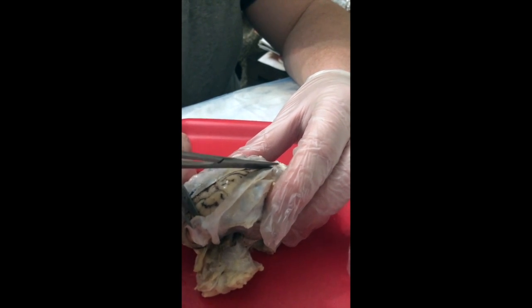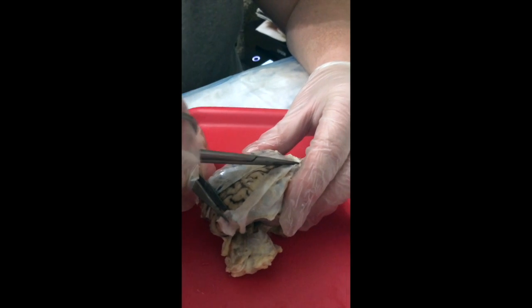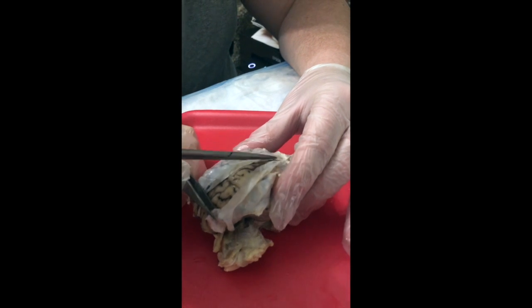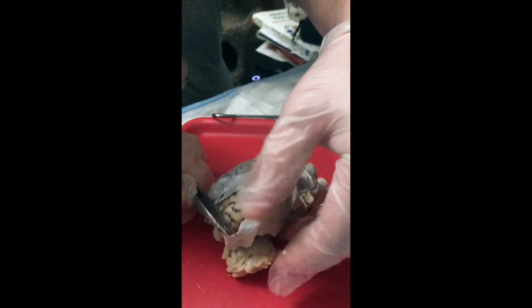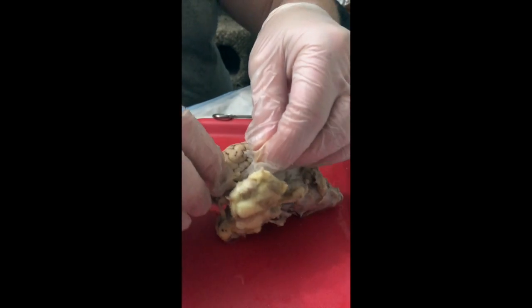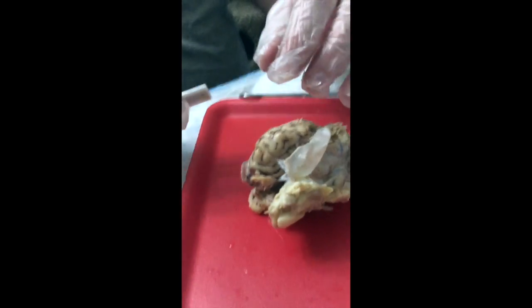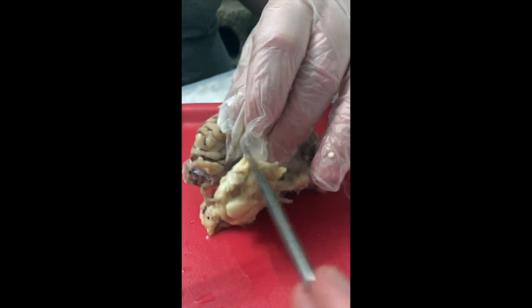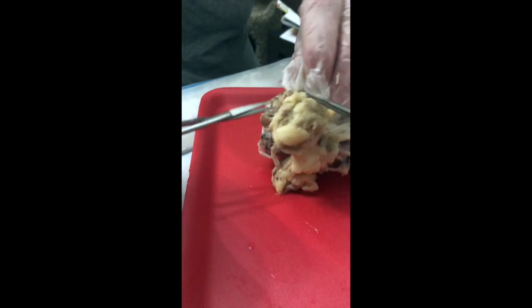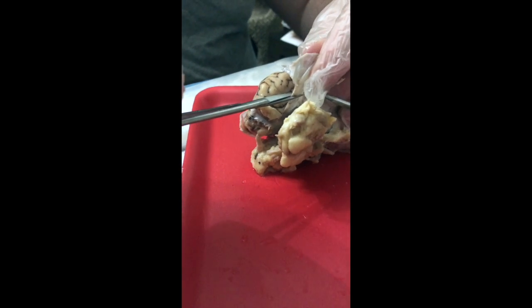So what's being cut now again is the two outermost layers of the meninges, the dura mater, which is the most superficial, sits just underneath the bones of the skull, and a small space below that called the subdural space, and then the arachnoid mater. And then the large space is the subarachnoid space. Just cut straight back right here. Nope, too far, right here. Right here? Yep, and just cut straight.